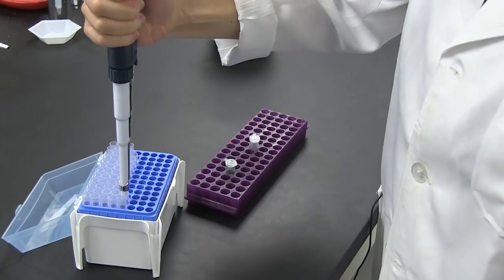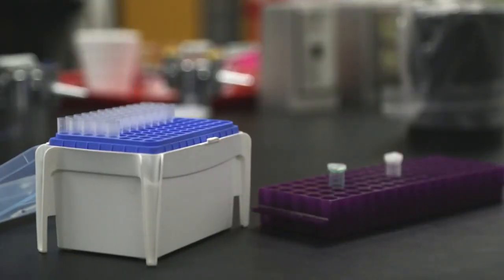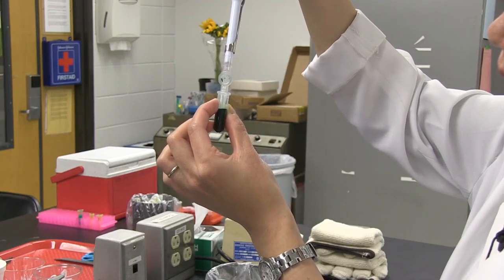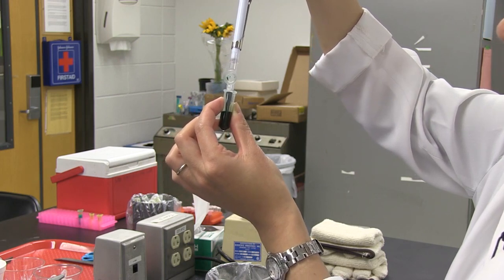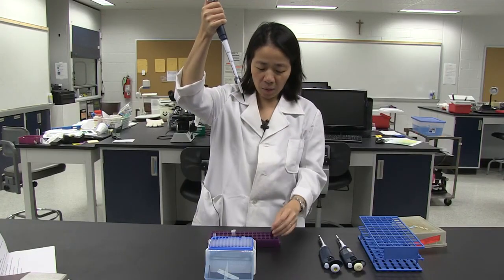After the first stop, you can actually press it down even further. To load a tip, go down like this and then make a little quarter turn. Take your liquid and press the plunger down. Insert the tip down into the liquid and gently and slowly release the plunger, using your thumb to guide the plunger going up. Notice that I'm going to bring everything to eye level.